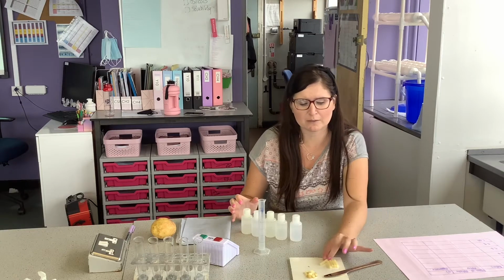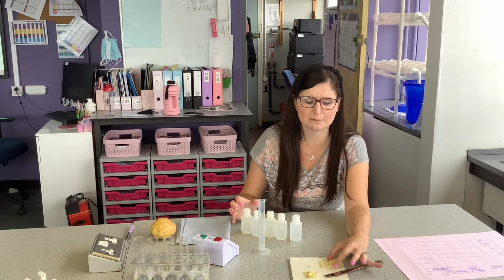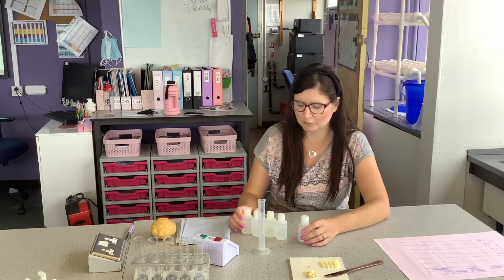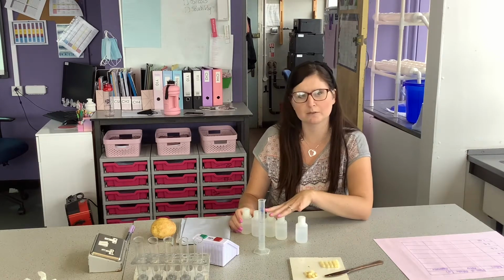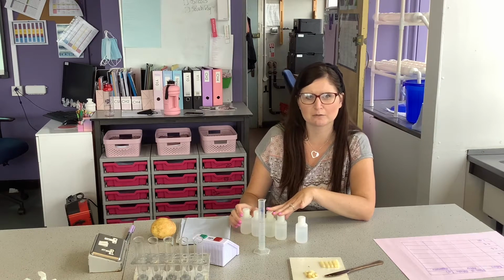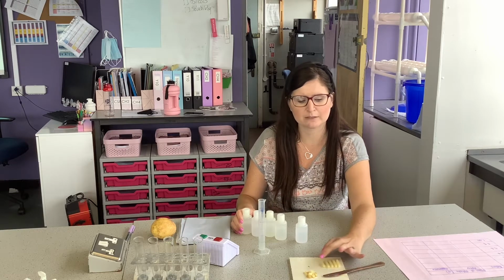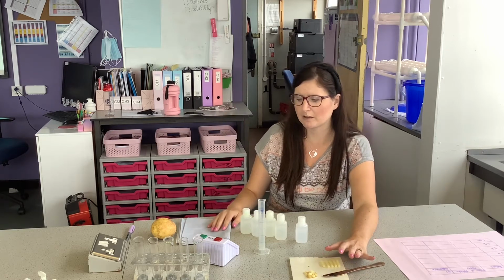What we're going to do then, we're going to see how osmosis affects the mass of a potato when we leave them in different salt solutions. So I've got 0.0 molar, 0.2, 0.4, 0.6, 0.8 and 1 molar concentrations of salt solutions. I've cut potatoes ready, but we need to go and weigh them.